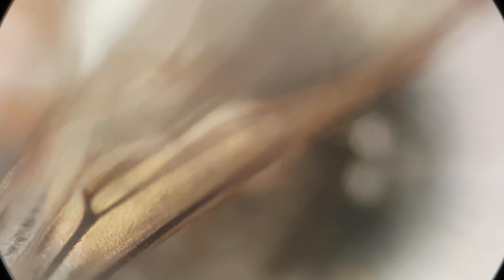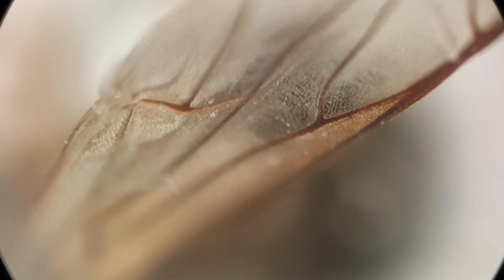I thought it would be fun to look at one of the wings under the compound microscope — oh, it's gone. Oops! As you can already see from this shot, the wing has some interesting features. It even has some hairs on top of the wing, which I actually didn't know. So that's new information to me.